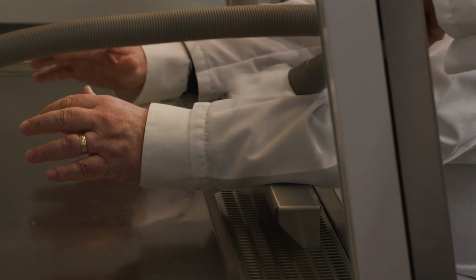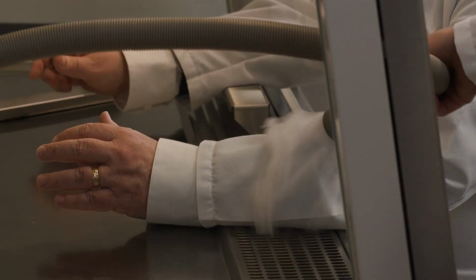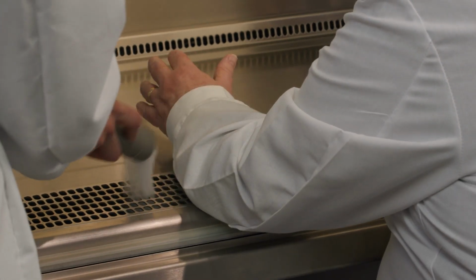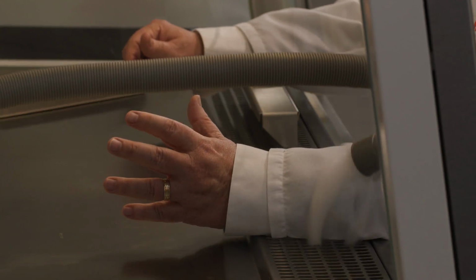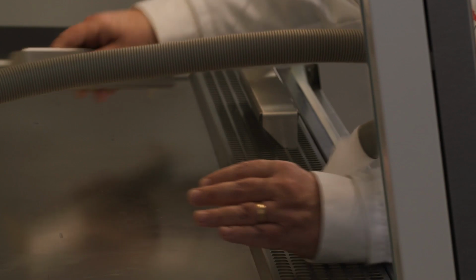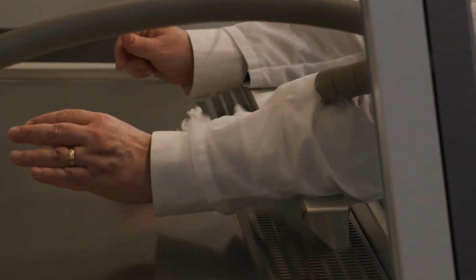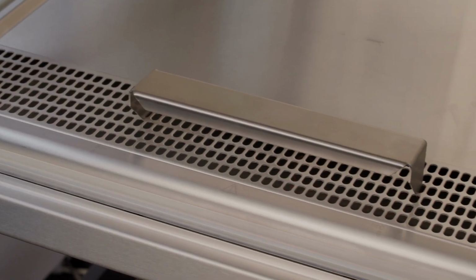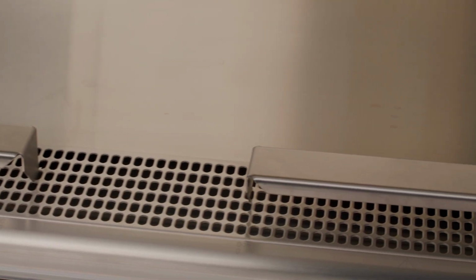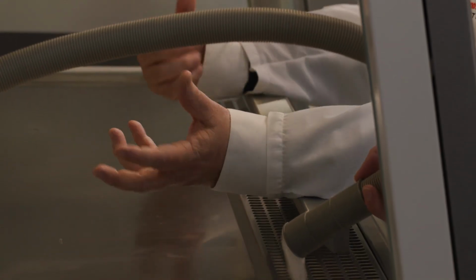And so we're going to compare that to how it is without the armrest. So if I take the armrest off. You're right, some of the smoke is getting more lost here and coming onto the work surface. And there's also an additional effect of when I reach forward, I tend to pull more forward, while if I do the same thing with the armrest in place, it's much less. So I think armrests, if you're not used to it, they seem a little awkward, but once you get the hang of it, one, it supports your forearms, which is good, but two, it actually improves the containment of the work area.